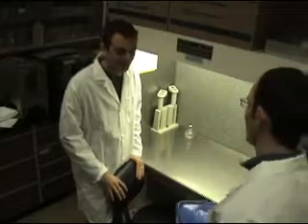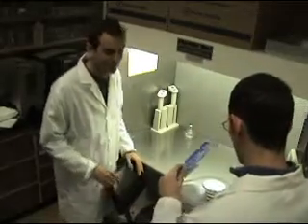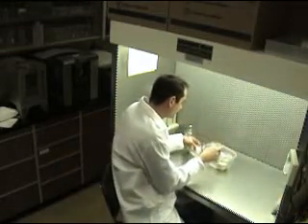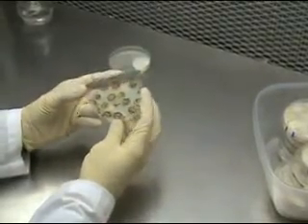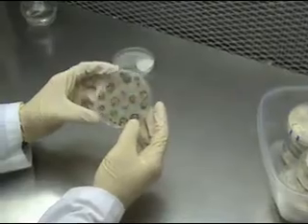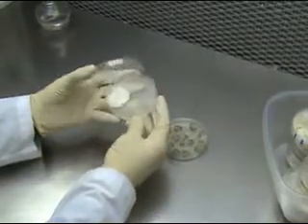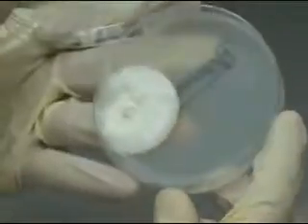Hey Everton, we have some colonies to look at — why don't you take a look at some of these we just finished growing? You see these colonies? They really look like Metarhizium, so we should make some slides of these colonies. And this colony looks like Beauveria, so we should make some slides too.